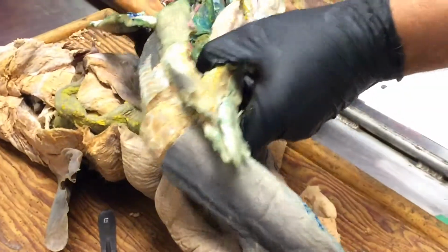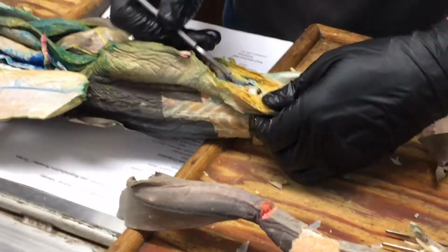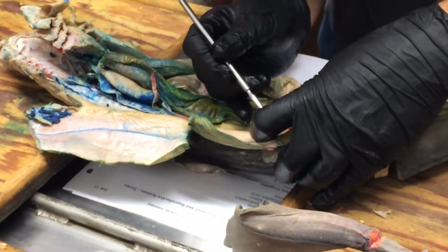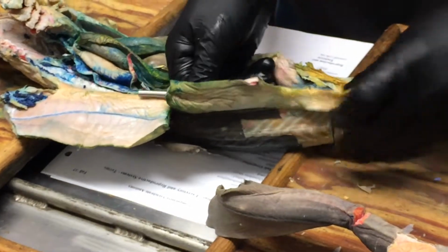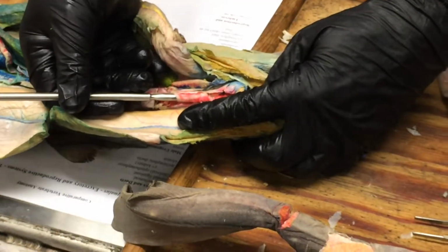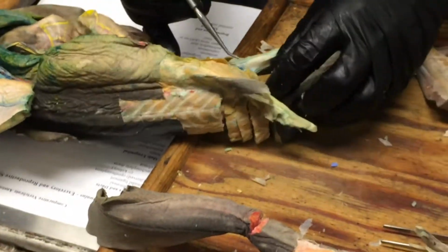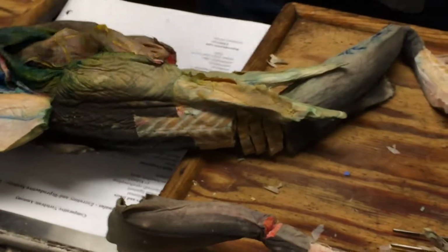Okay. So if we were to pass a probe down through the archinephric duct here and into the sperm sac. Wow, could we do that? Should be able to do. There it is. Oh, that's so cool. With any luck, that's where it goes. There it is inside of the seminal vesicle. And that's going to run all the way down, and eventually it would pop out at the tip of the urogenital papilla, which we are familiar with here inside the cloaca. Okay, so that's where these are all coming out.